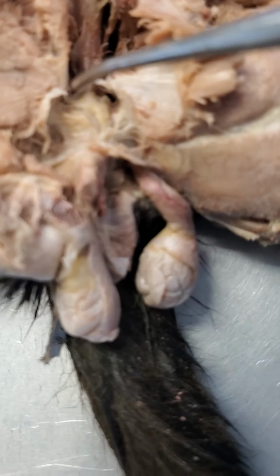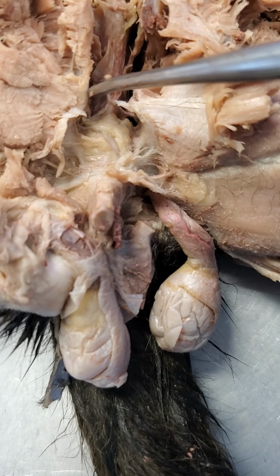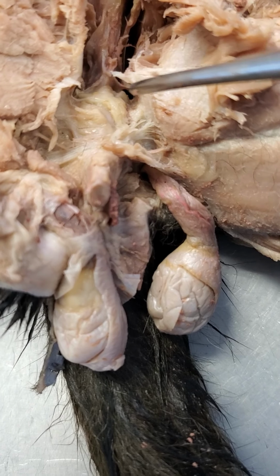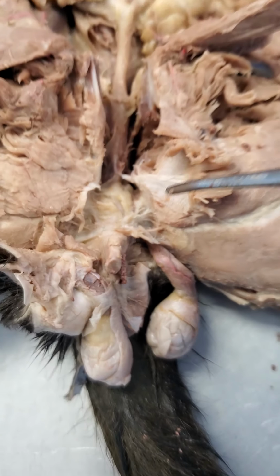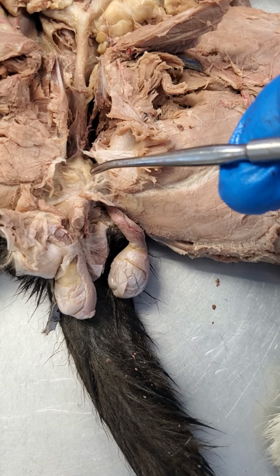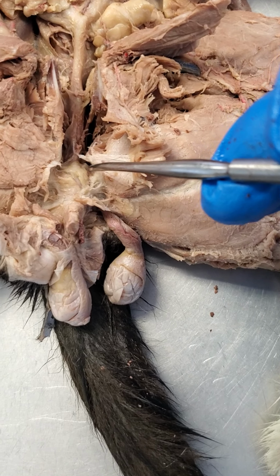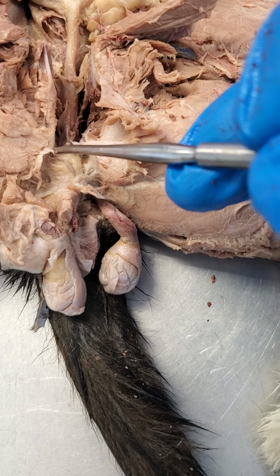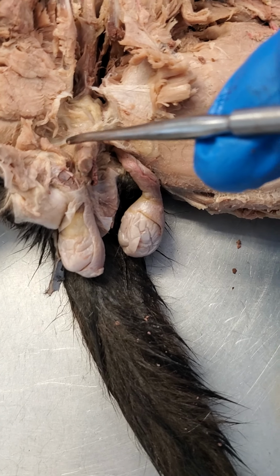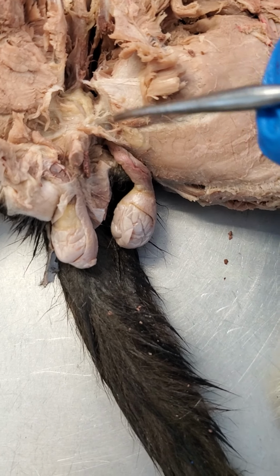And then way down here, it's a little bit hard to see. Let's see if I can focus on here. You can see those little nodules right there on either side. There's a little one right there at the tip of this probe, and there's another one right here. Those are going to be the bulbourethral glands, which are also called the Cowper's glands. So again we have urethra, prostate gland, and then we have these two really small bulbourethral glands towards the end of that urethra. And of course right here, once the urethra leaves the abdominal wall, this right here is going to be the penis of the cat.